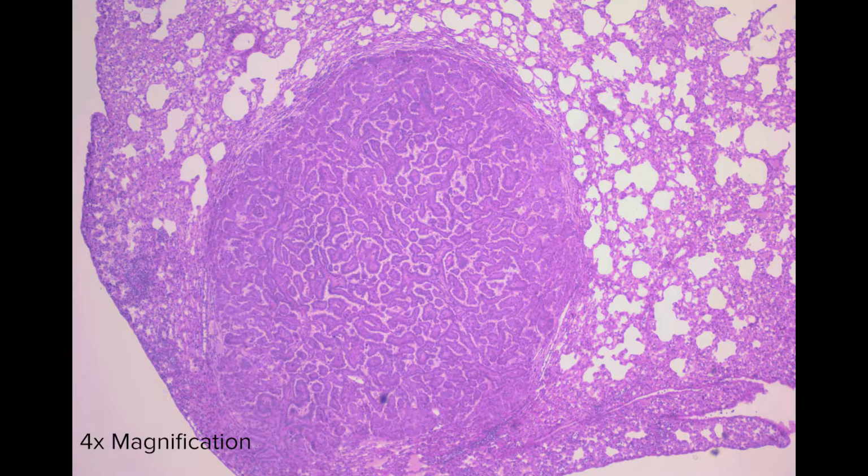Cancer researchers learn a great deal about healthy cells and cancer cells by preserving them, staining them in different ways, and then studying them under different kinds of microscopes. Here are a few examples of cells that have been prepared and stained in 3 different ways to bring out particular features. Here's an example of light microscopy.